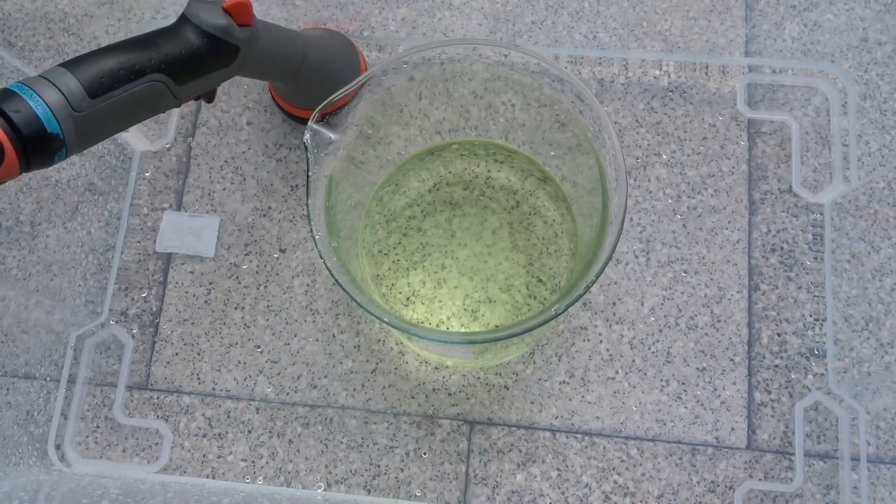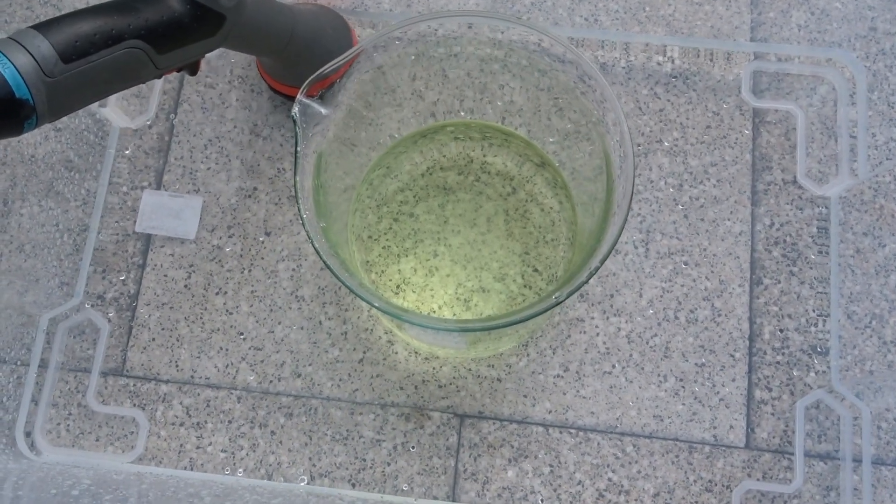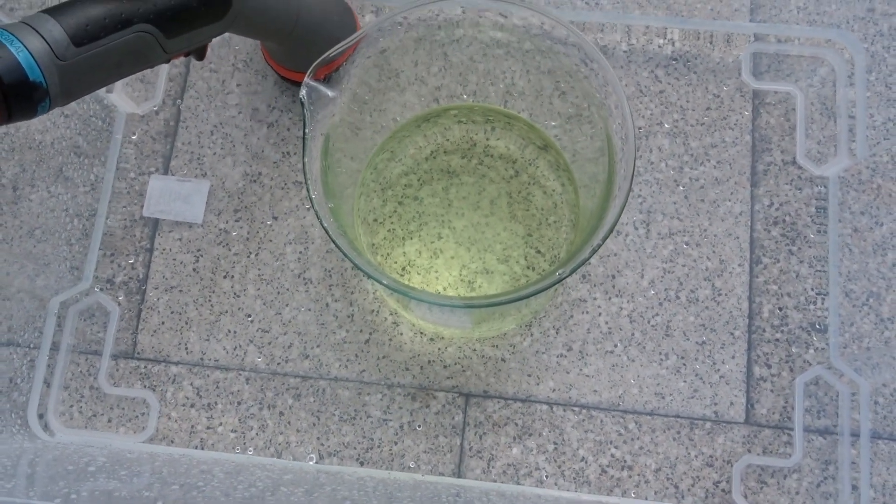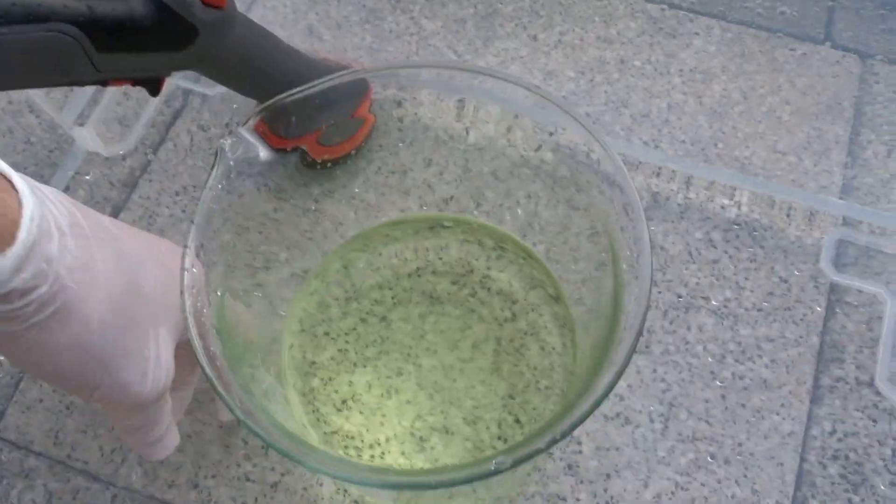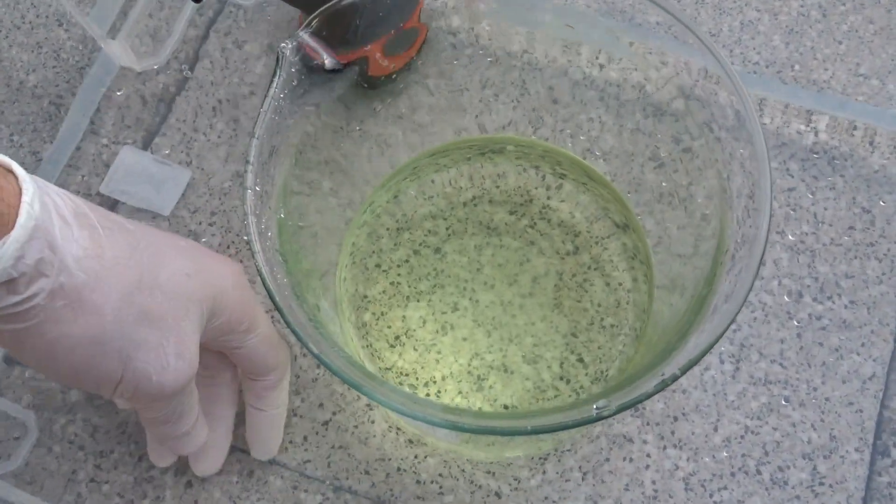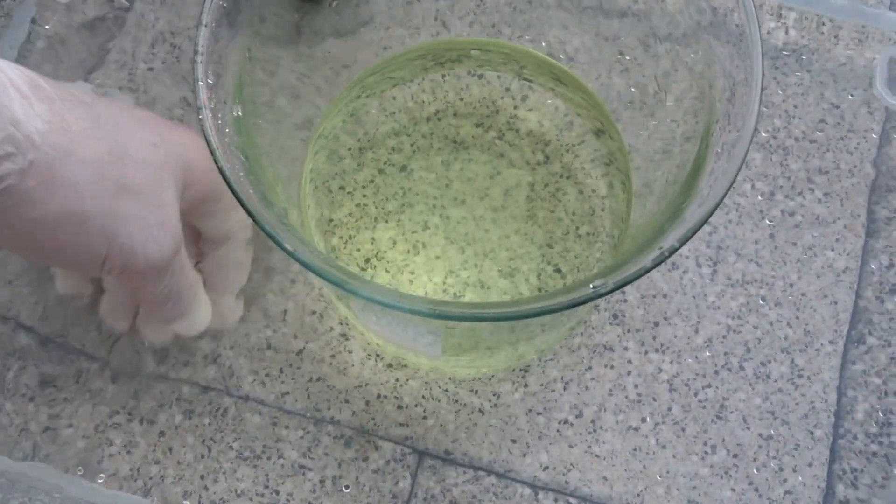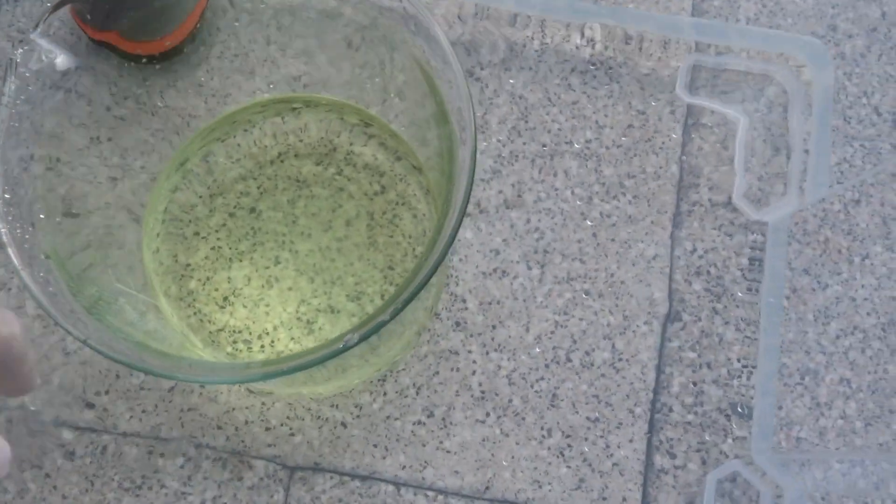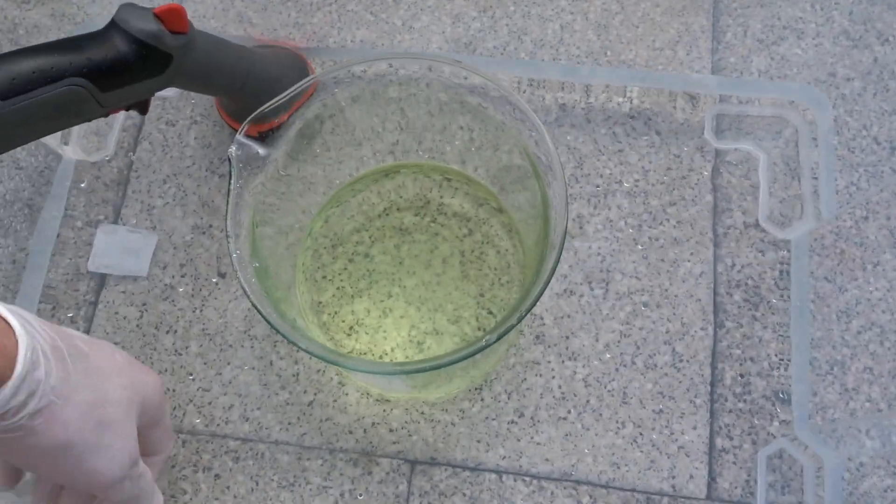Right now cooling is being added. Because this reaction is exothermic, I do not have any ice. In order to prevent at least some of the chloroform from instantly vaporizing, I'm going to use cold water. Well, it's 20°C. A gigantic amount.